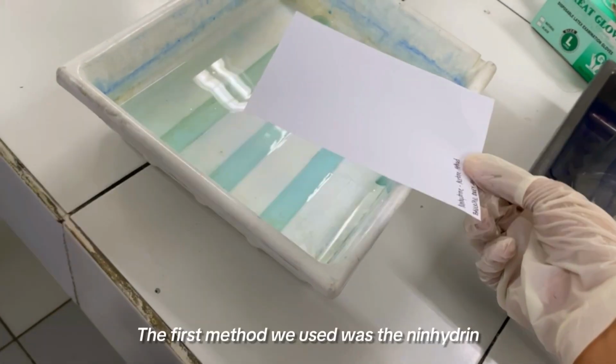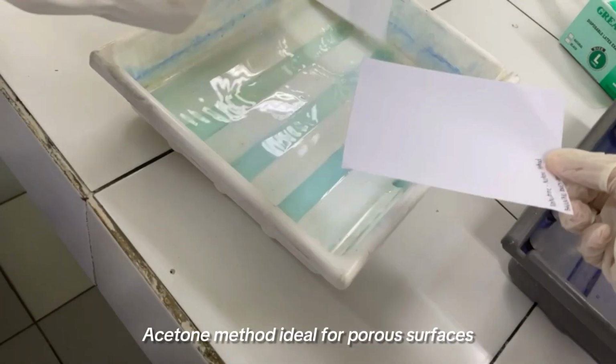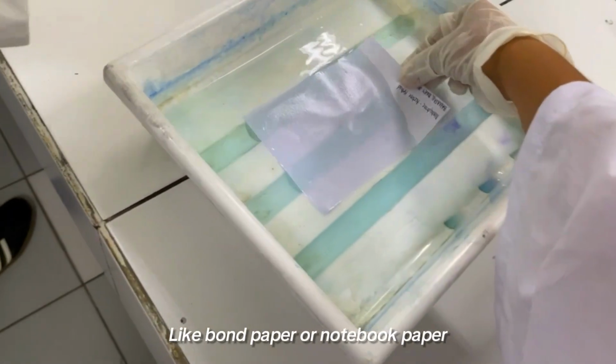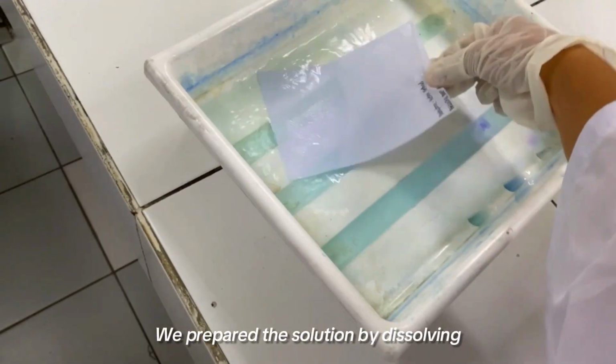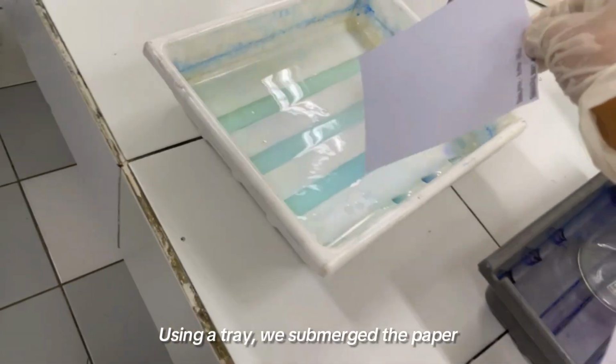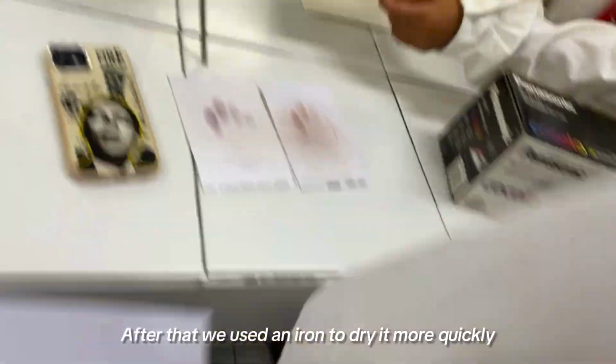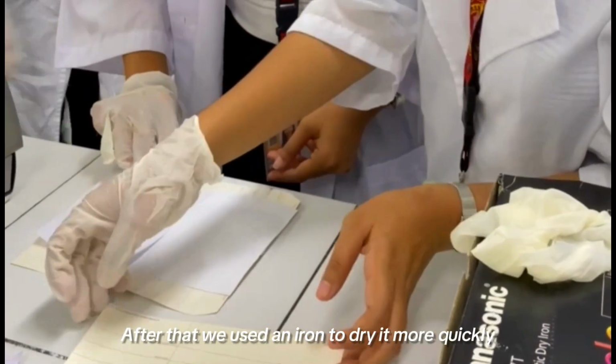Ninhydrin-Acetone Method. The first method we used was the Ninhydrin-Acetone Method, ideal for porous surfaces like bond paper or notebook paper. We prepared the solution by dissolving ninhydrin powder in acetone. Using a tray, we submerged the paper containing latent prints into the solution. After that, we used an iron to dry it more quickly.